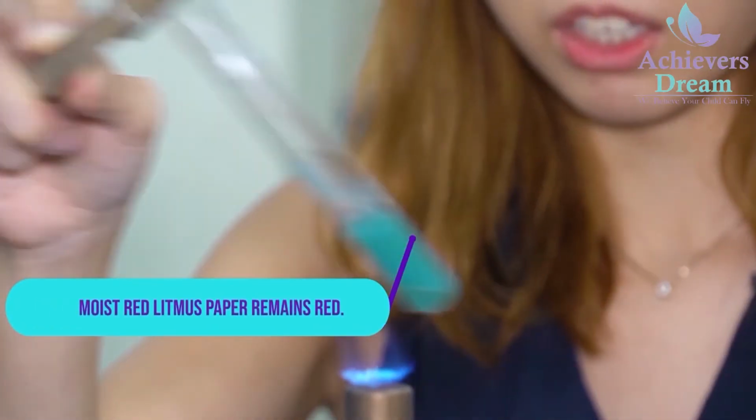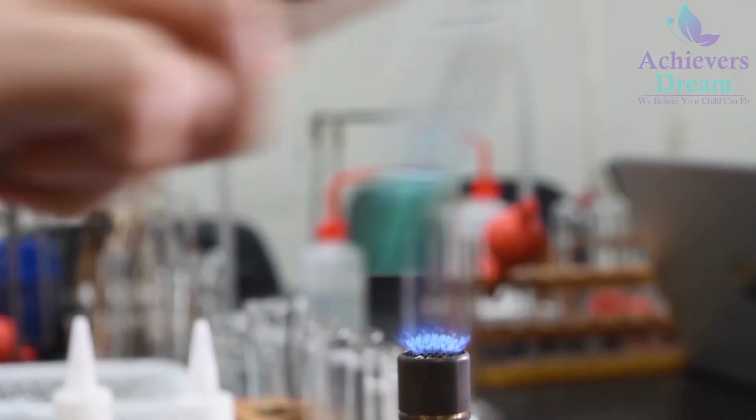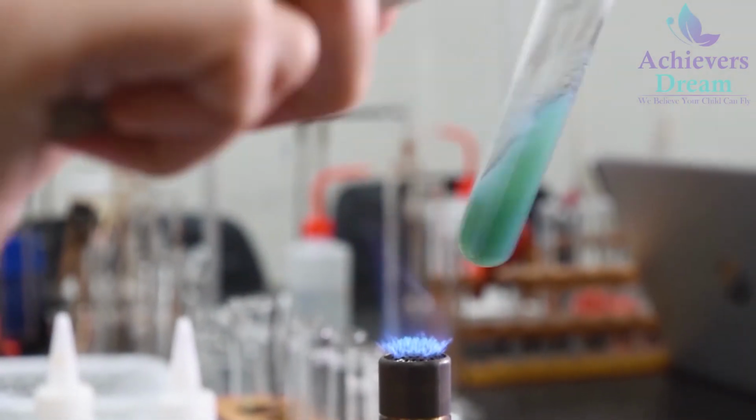So your moist red litmus paper remains red. Now I'm just going to heat till there's no further change.